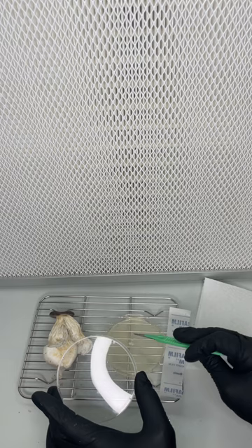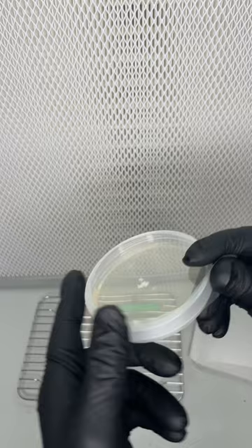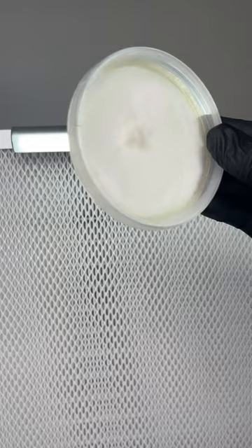I wrapped it in parafilm and allowed it to grow at 75 degrees Fahrenheit for two weeks. The mycelium completely covers the agar plate, which we can now use to make more fruiting blocks.